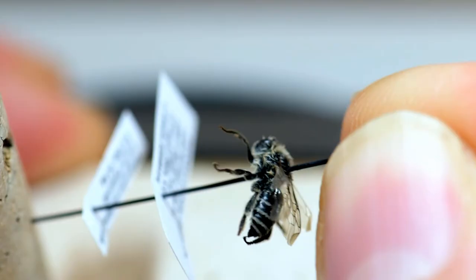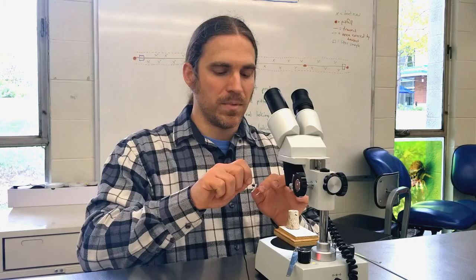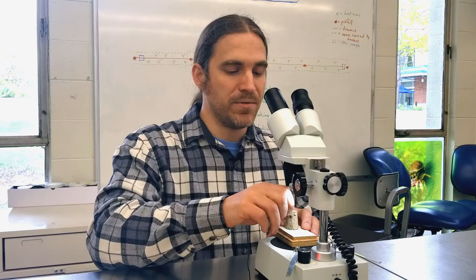If you want to look at the wing, you can turn the specimen while it's in the cork to see the face, or turn it further to see the abdomen. If you need to see the specimen from underneath — sometimes there are characters on the bottom of the abdomen or thorax, or you need an angle on the legs — there are a couple of ways to do that.